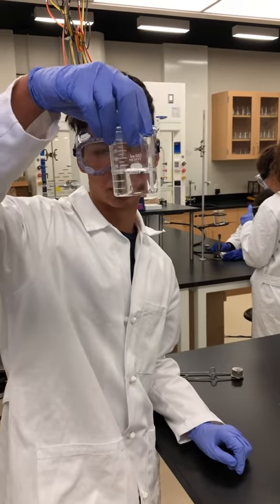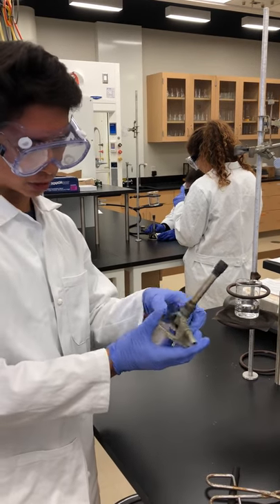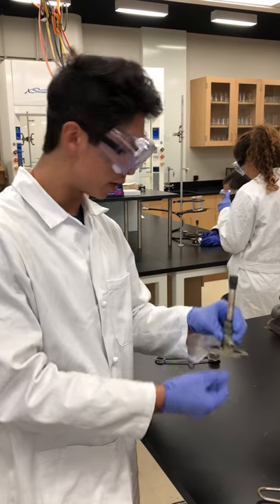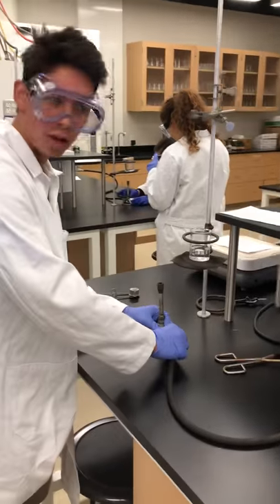You'll want to see there are no cracks or holes in it. I'll take the Bunsen burner, make sure the gas valve is completely closed. I'm going to do one turn to open it all the way. Place it down. Get the gas hose attached here.